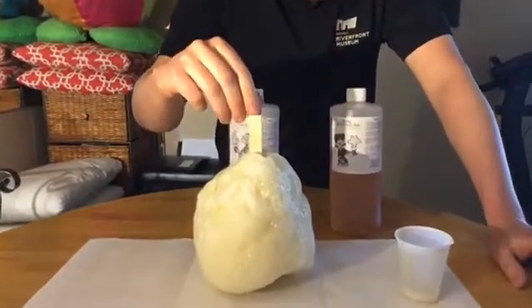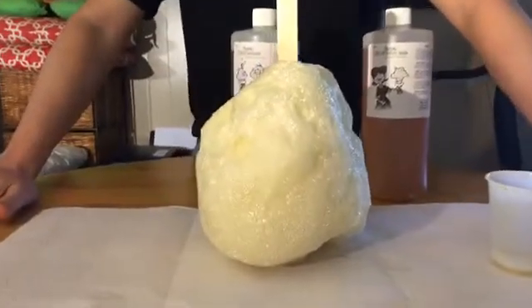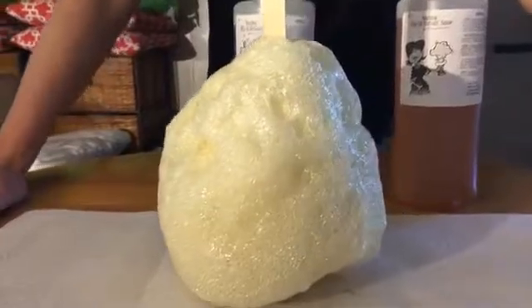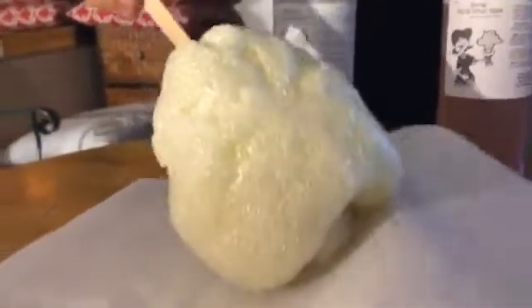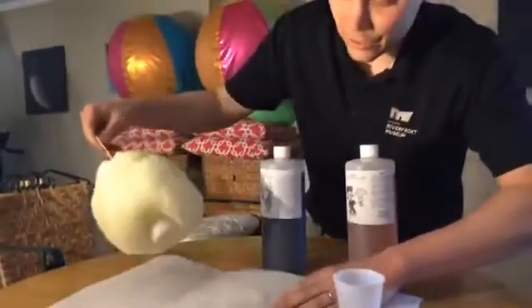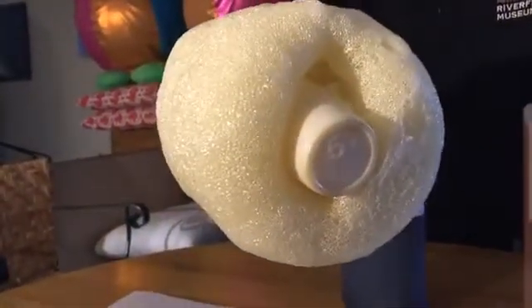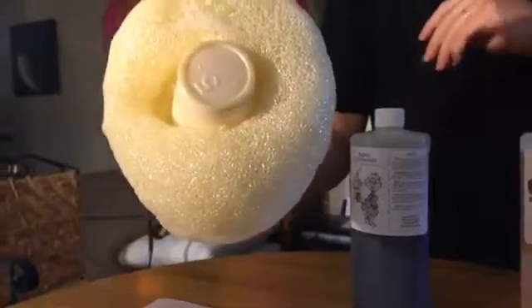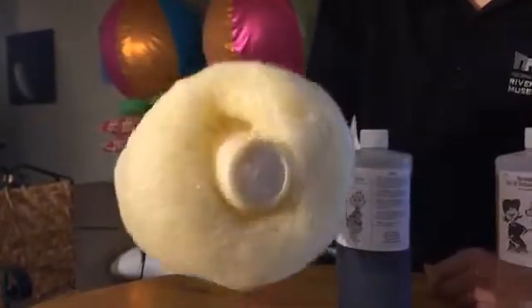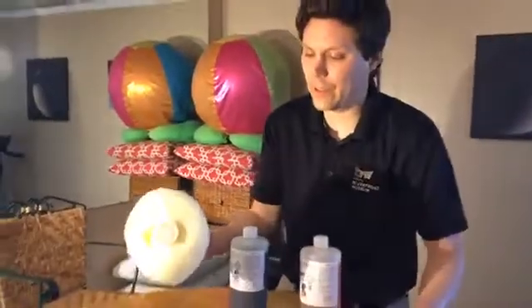But very quickly, after turning to that new liquid, that liquid solidifies. And so now instead of a liquid, we have a solid. It's a foam, a type of plastic called polyurethane. It's a little bit sticky there. But you might hear it popping a little bit as those gases it makes pop. It's also filled with a bunch of air cavities. So very low density, much larger substance than we had to begin with.